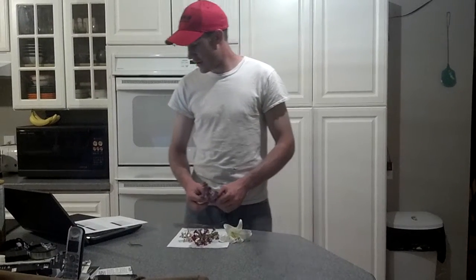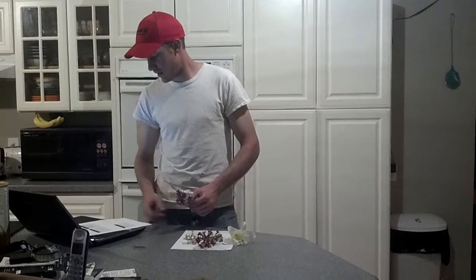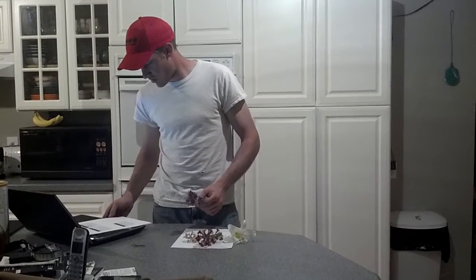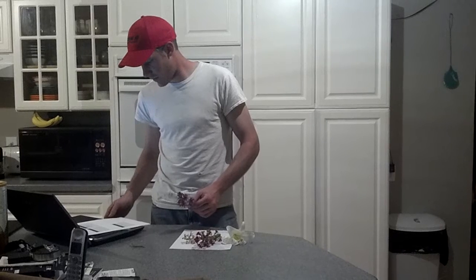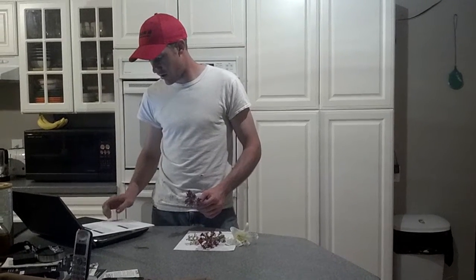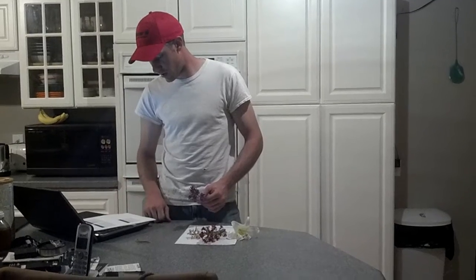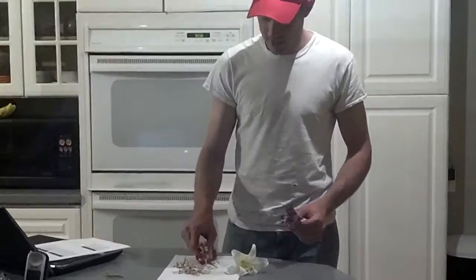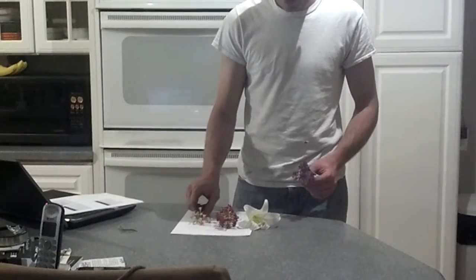So for this lab, I'm supposed to collect and identify floral parts on 4 selected flowers, describe the functions of each part, identify between the stamens and pistils, and then later go on and draw each flower and label its parts. So if you zoom in here, I've got 4 flowers.